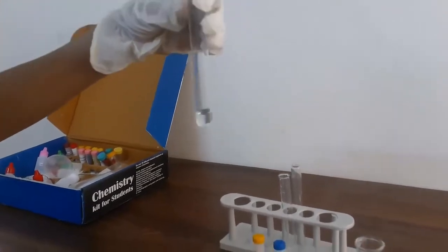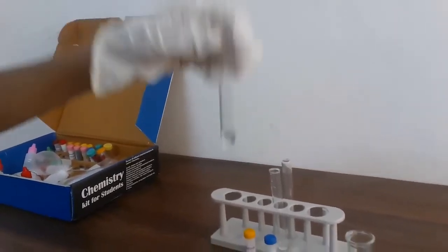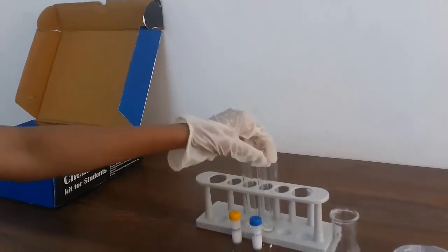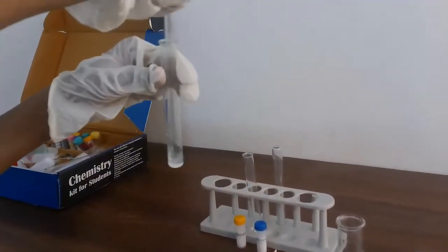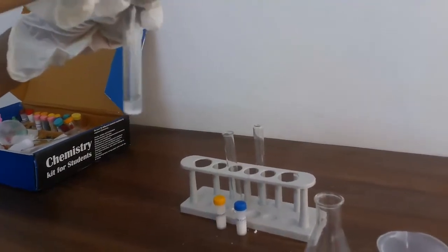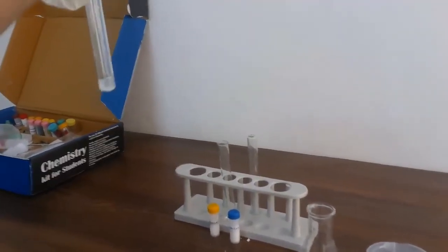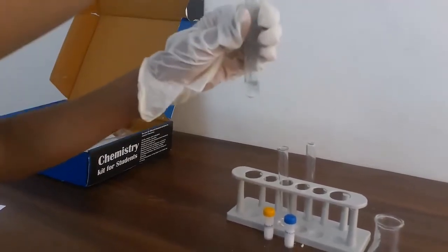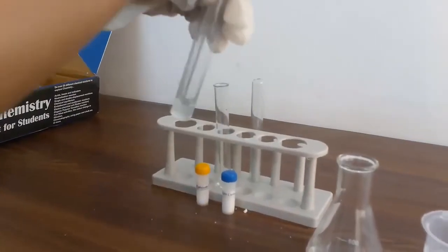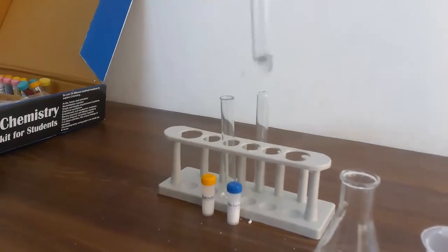Okay, over here you can see mine is already dissolved. And now the second one I'm also going to have to dissolve. This is going to take a while to dissolve. Okay yeah, you can see over here mine is already dissolved now.